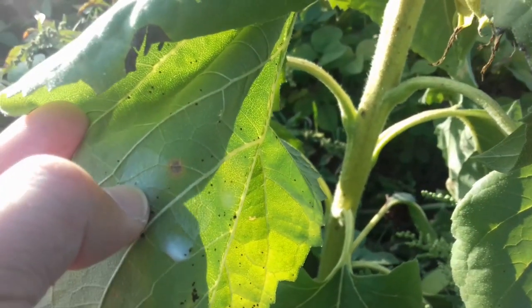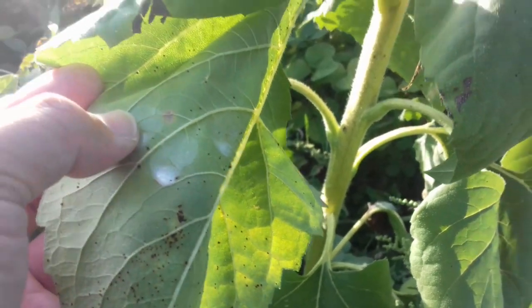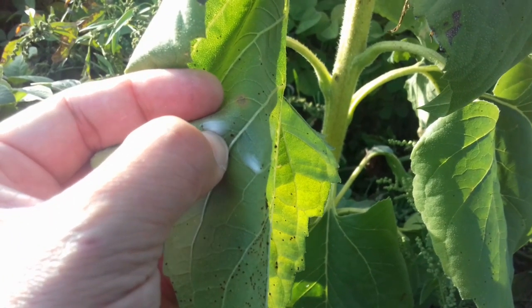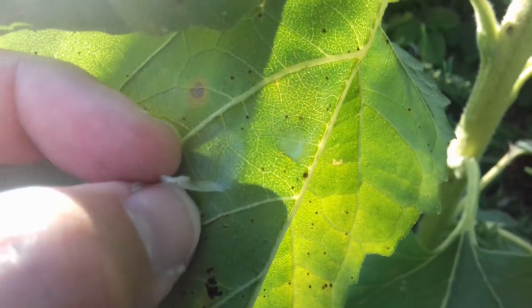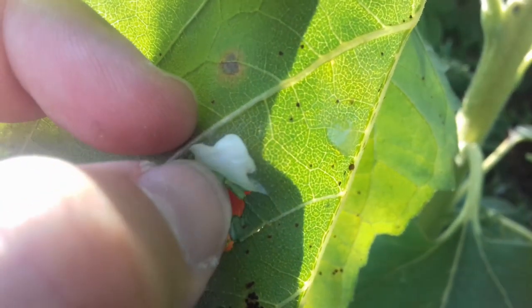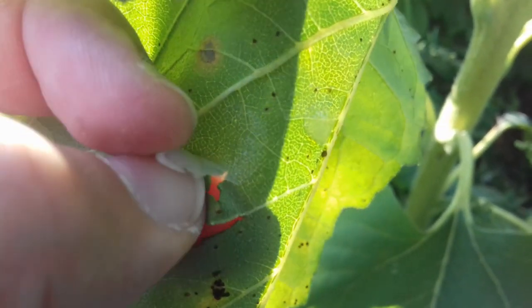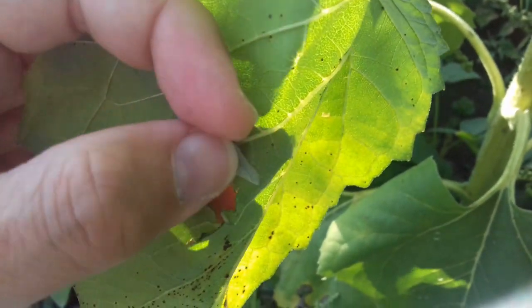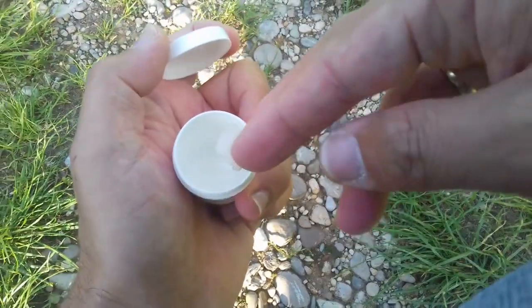It does feel reasonably solid, so I might be able to peel it off. The same problem as before — I actually need both hands but I also have to hold my camera, so I'm going to put the camera on my knee. Doing this with one finger is difficult. I started to peel it off and if you carefully work your way upward you might actually get it off. Okay, here we go — that was not so easy, so I'm just going to put this into the container.